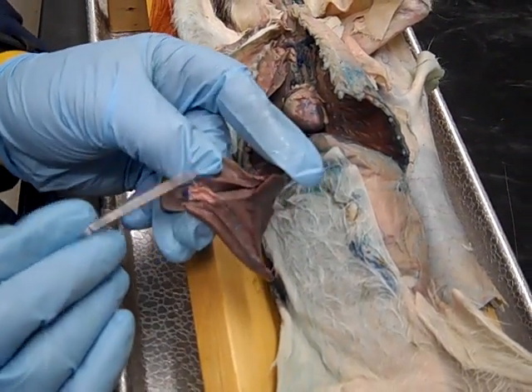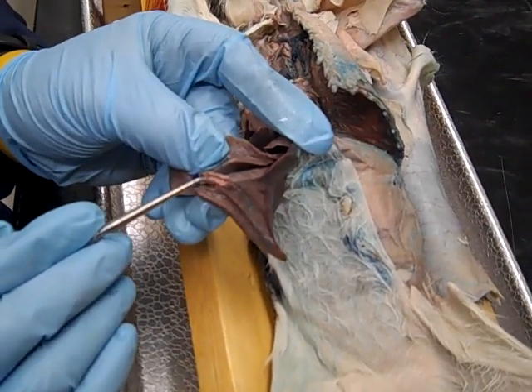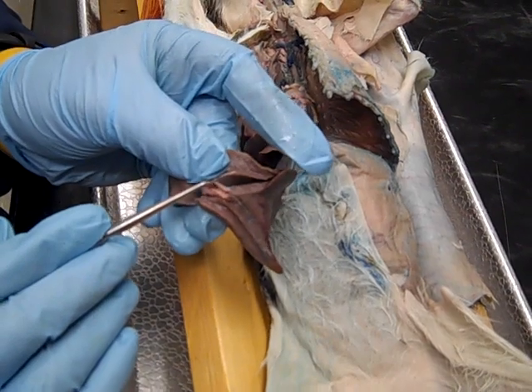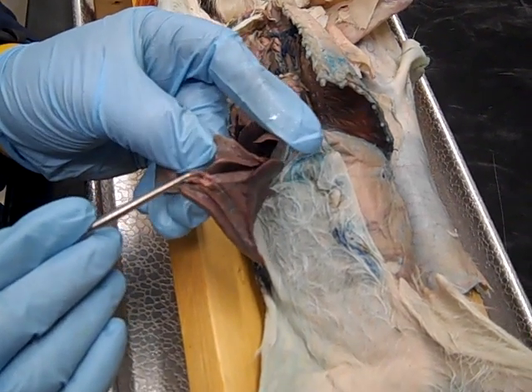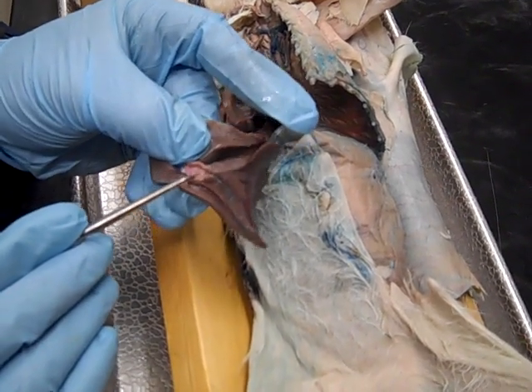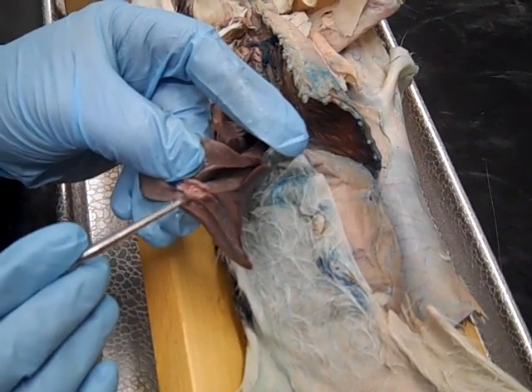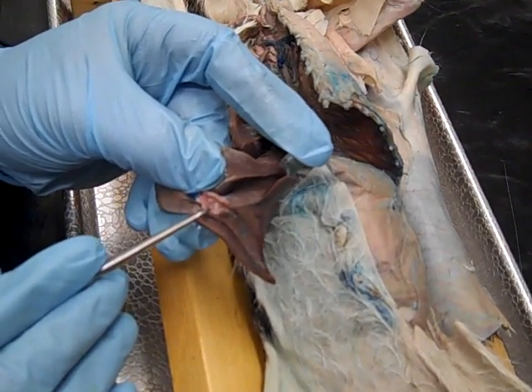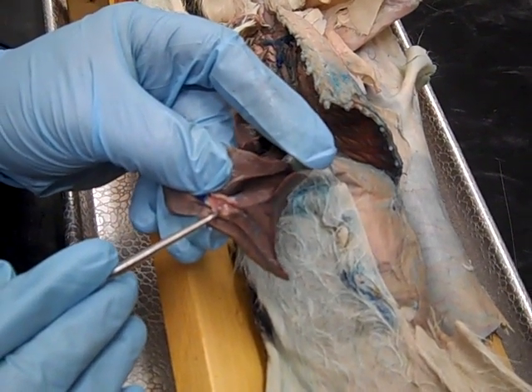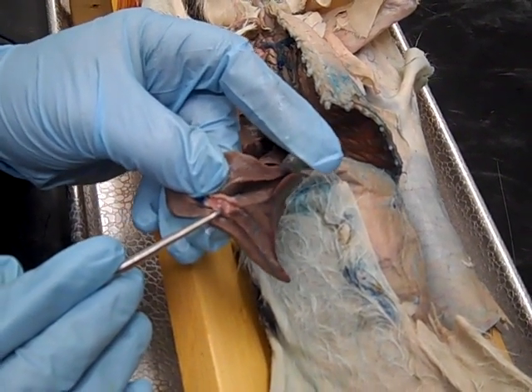I'm going to try to open this up for you so you can see inside, and perhaps we'll get enough detail. You can see inside there are little openings running off of this bronchus, and those are bronchi going out into the lung itself.